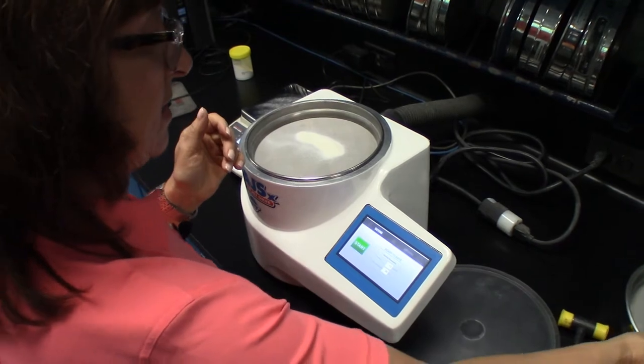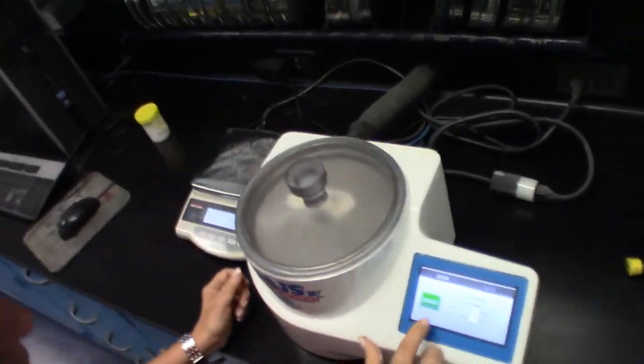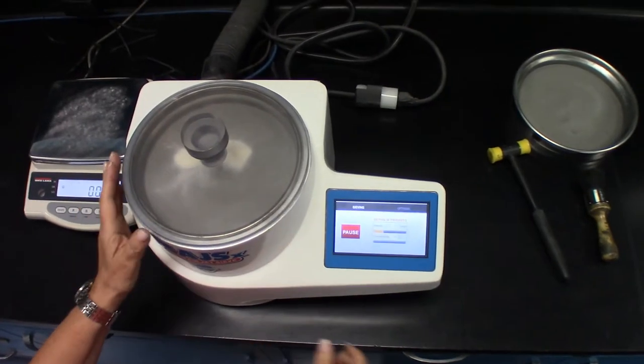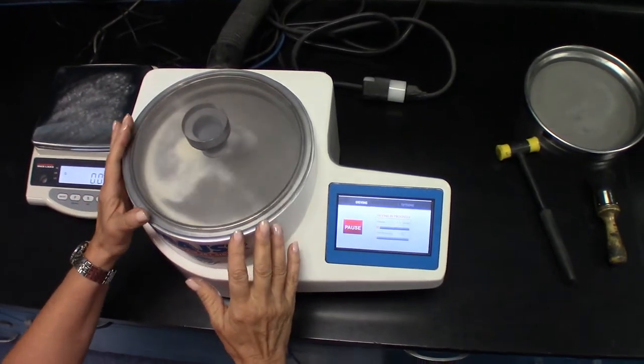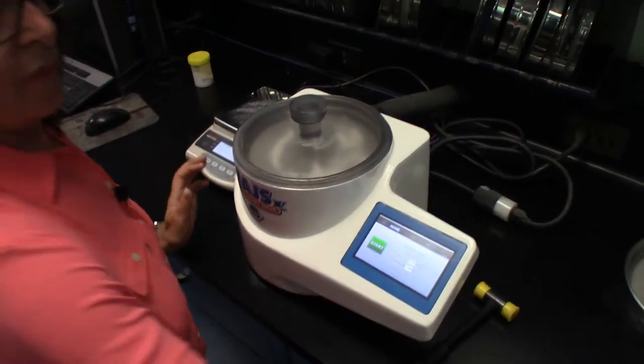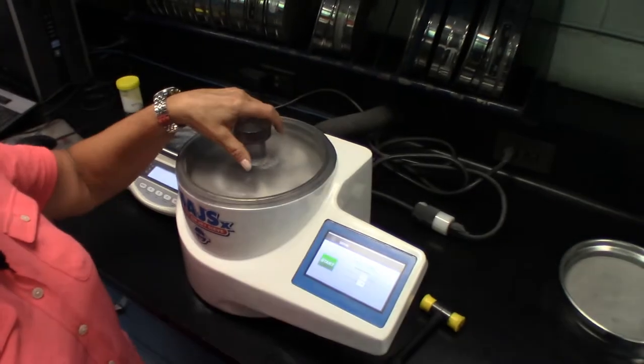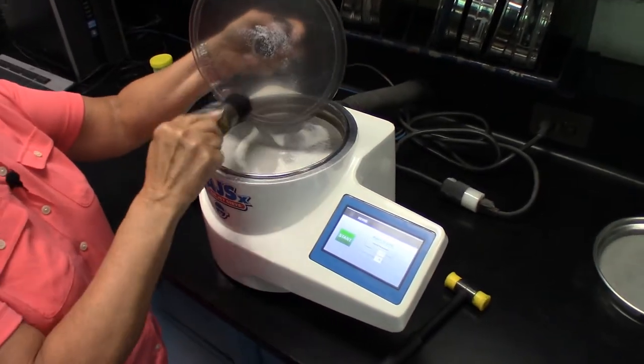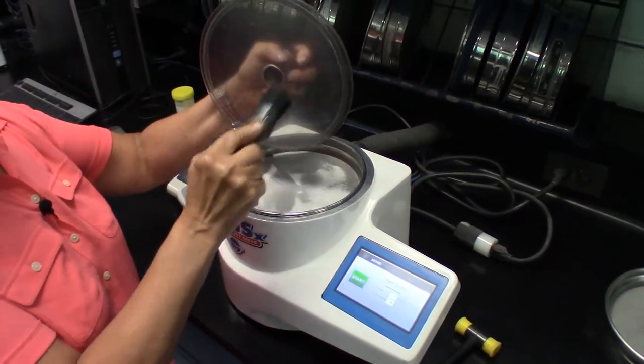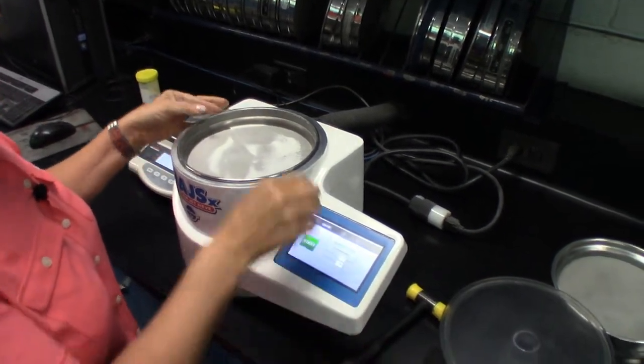And repeat the process. Press start. Once the sieving is completed, remove the cover, brush the fines back onto the sieve screen, and we're going to re-weigh this screen.